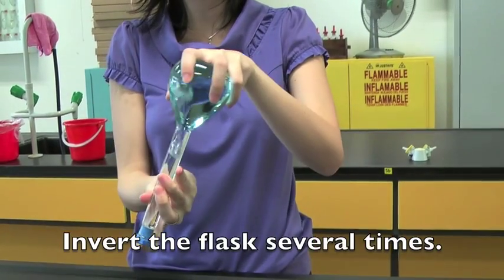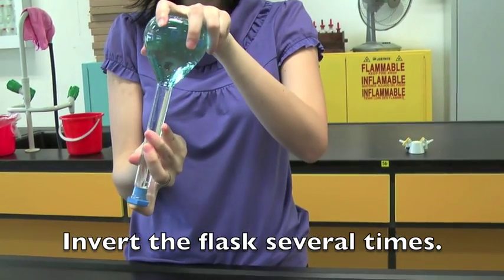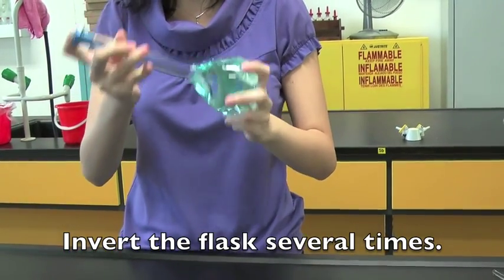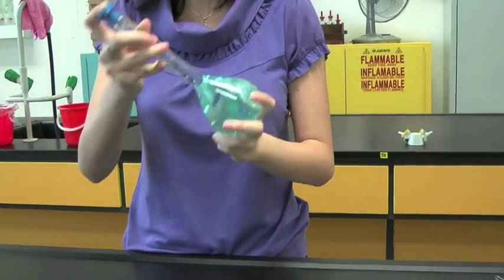Lastly, invert the flask several times. This is to ensure a homogeneous solution is obtained.